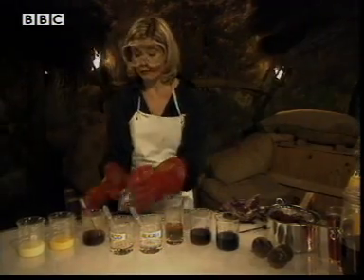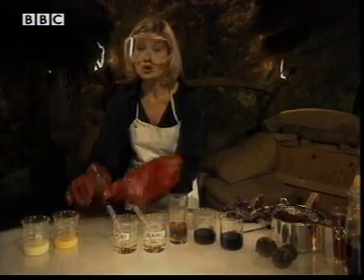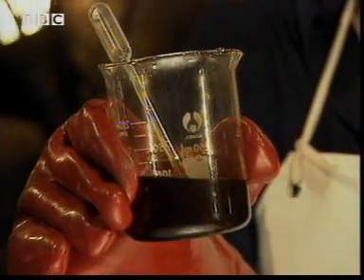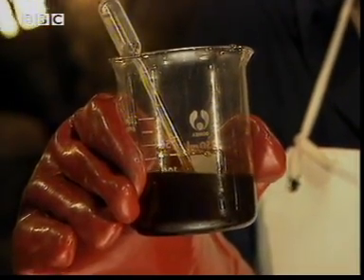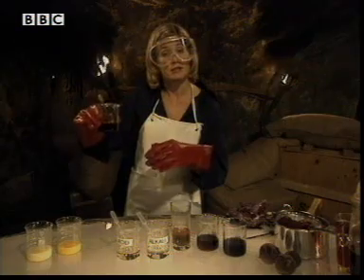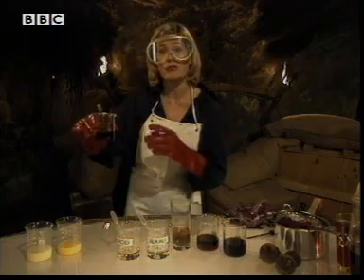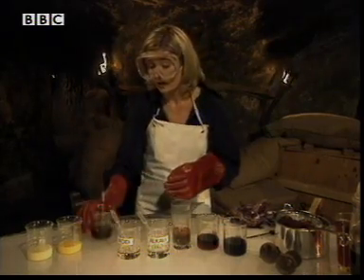In our investigation, Femi was using Universal Indicator. This is a mix of a number of different indicators, and it's particularly good because of the range of colours it produces.